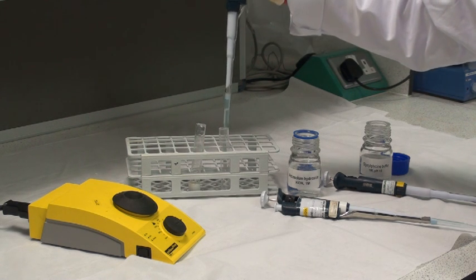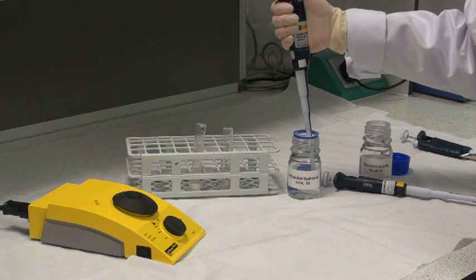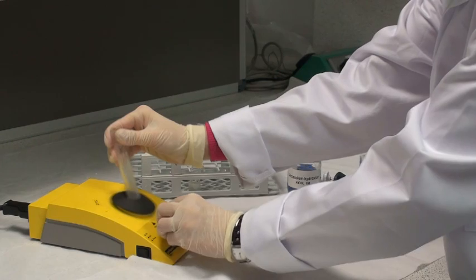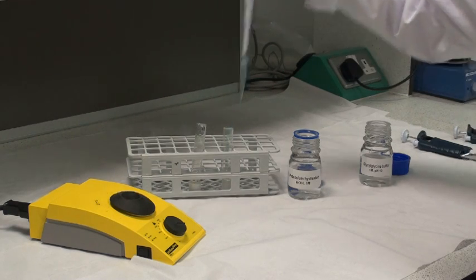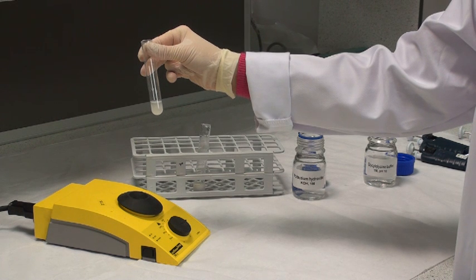Transfer 1 mL of the perchloric acid centrifugation sample solution into the bottom of a clean glass test tube. To this, add 0.5 mL of 1 M potassium hydroxide solution and mix the contents thoroughly on a vortex mixer. Then add 0.5 mL of 1 M buffer solution as used in the particular assay, and mix the tube contents thoroughly. This solution, which contains insoluble potassium perchlorate, is centrifuged at 1500 g to give a clear supernatant used in the subsequent assay.